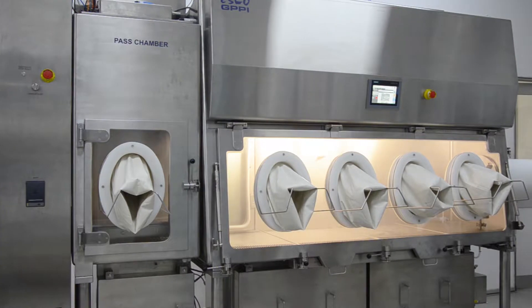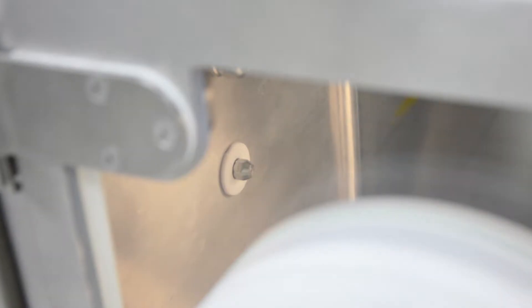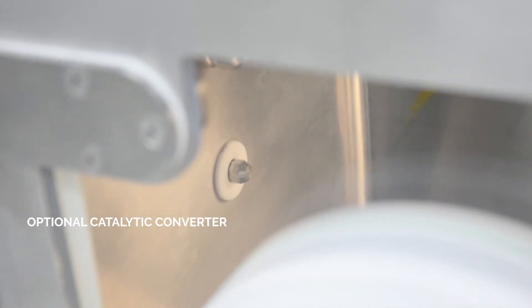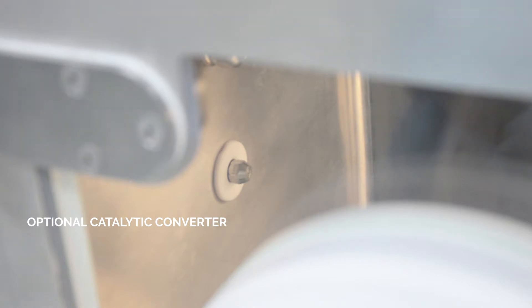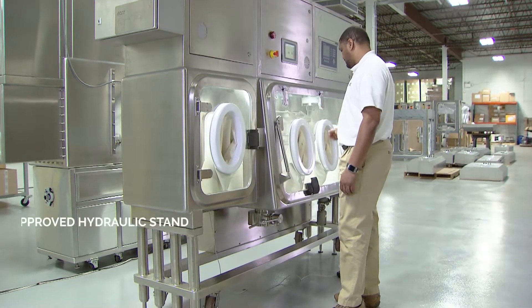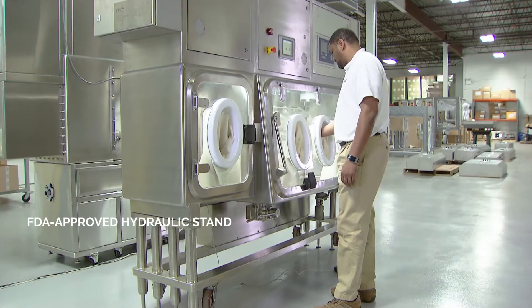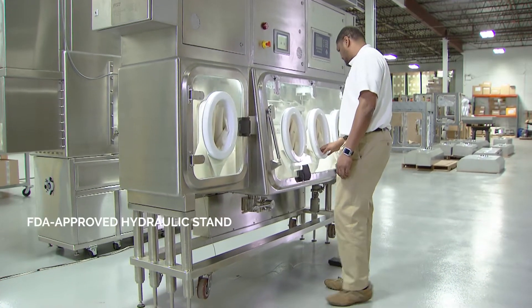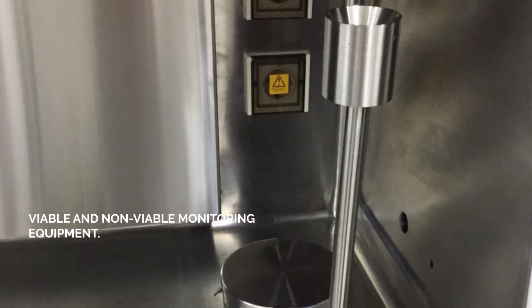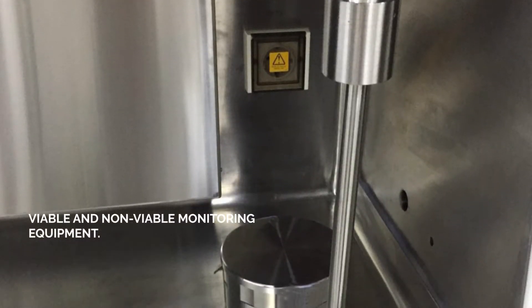The GPPI can be fully integrated with hydrogen peroxide bio-decontamination, providing six-log reduction in viable contaminants. It also comes with optional on-board exhaust catalytic converter with an interlocked external hydrogen peroxide sensor for safety. It is designed with an FDA-approved hydraulic stand that can be raised and lowered by the operator for optimum ergonomic comfort.